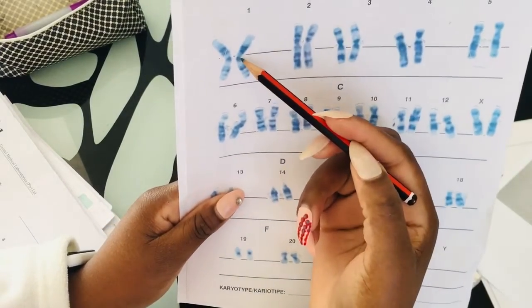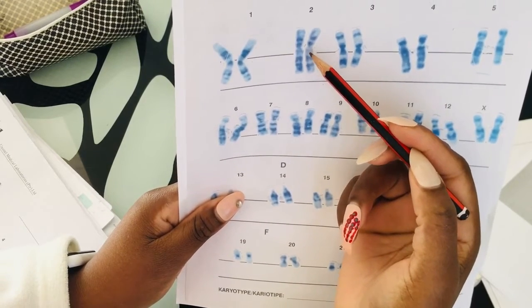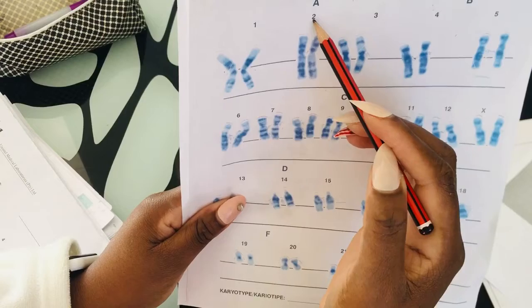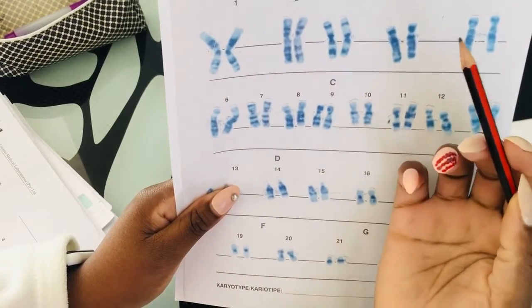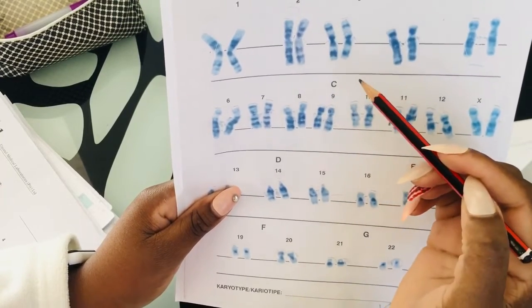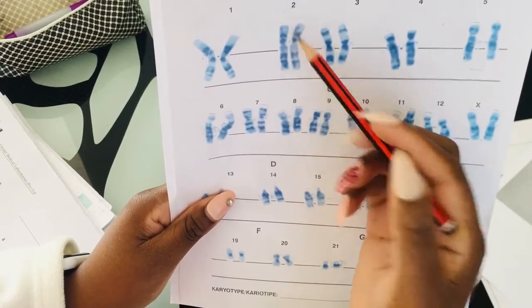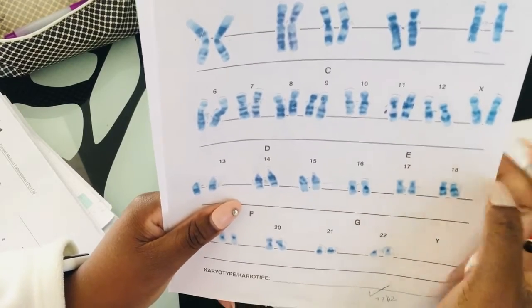If you compare the centromere location of chromosome 1 and that of chromosome 2, you may agree with me that this is a little bit up. It looks like a submetacentric chromosome to me, but different textbooks can say different things. The most important thing in this video is that you can easily locate your chromosome number 2. It's going to have lots of bands, as you can see, and be your second longest chromosome.